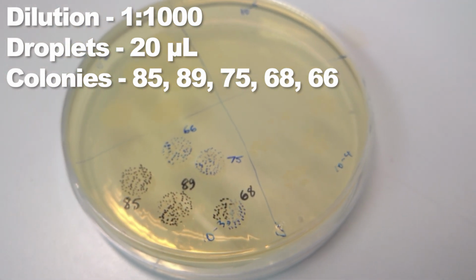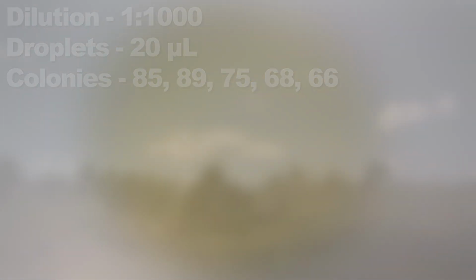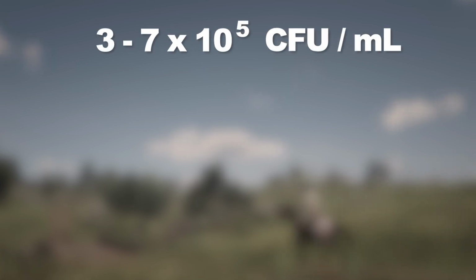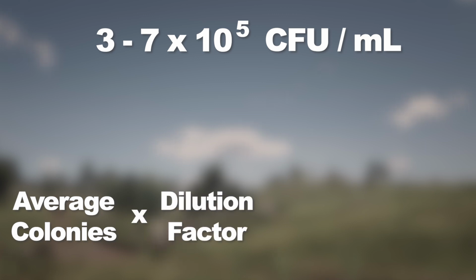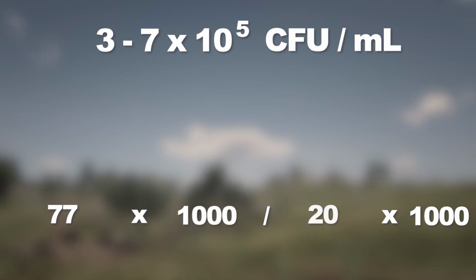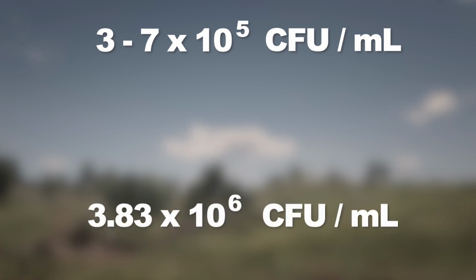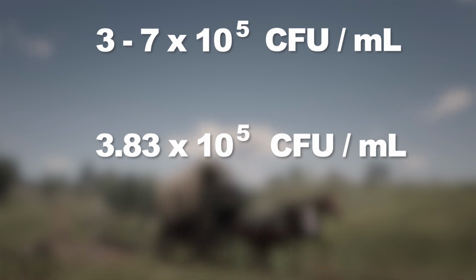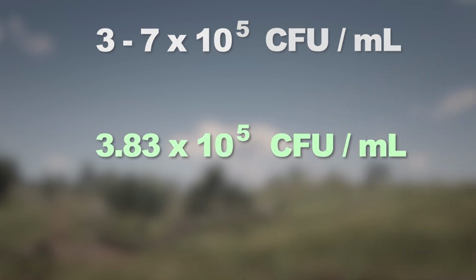In order for the MIC to be valid, we need to have inoculated the plate with the correct amount of cells, 5 times 10^5. An acceptable range is 3 to 7 times 10^5 CFU per mil. We can calculate our starting inoculum density by multiplying the average number of colonies we counted by their dilution factor, then dividing that by the droplet size in microliters, and multiplying by 1,000 to give us CFU per mil. As we used 10 microliters of our inoculum in a final volume of 100 microliters, we need to divide this number by 10. If this falls within our acceptable range, then the MIC is valid.